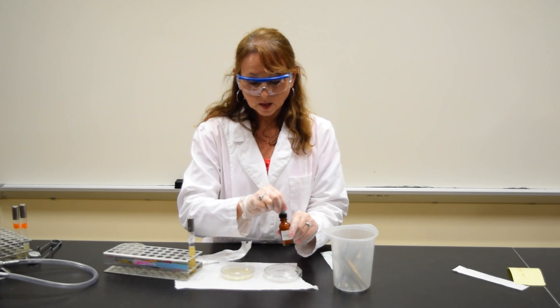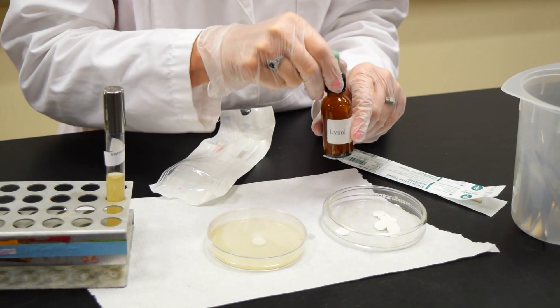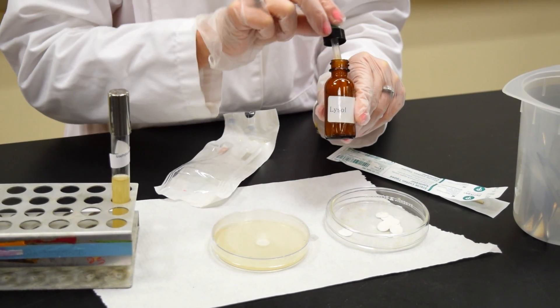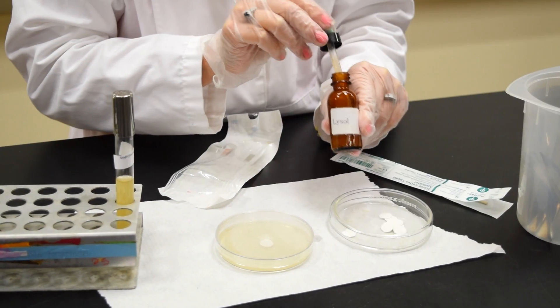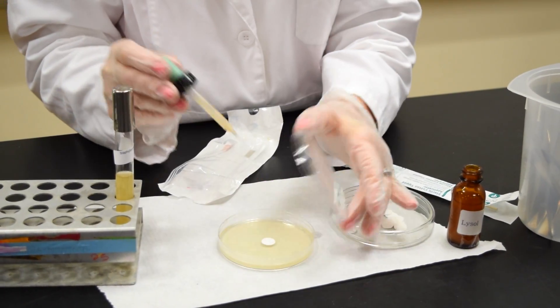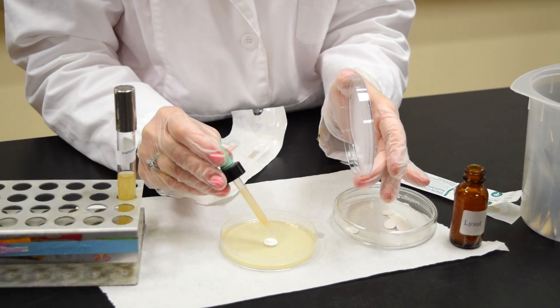I'm going to apply one drop of the chemical I'd like to test — in this case it's Lysol — to the filter pad.